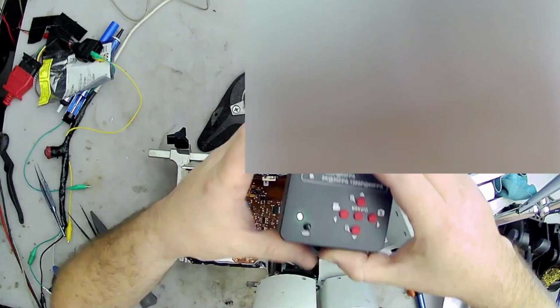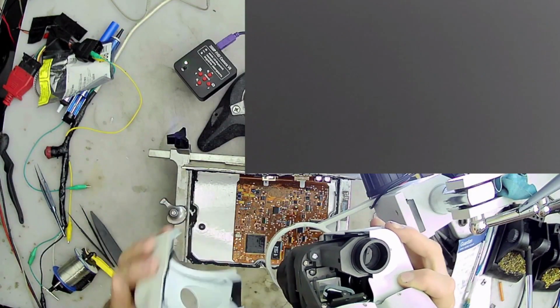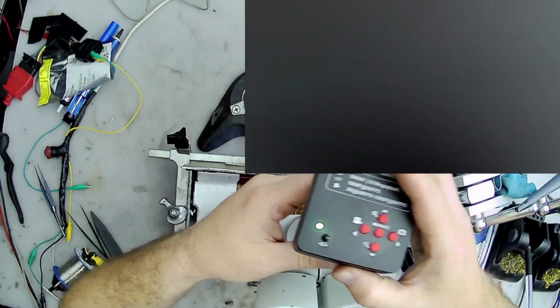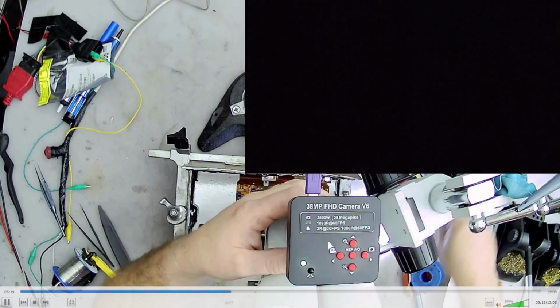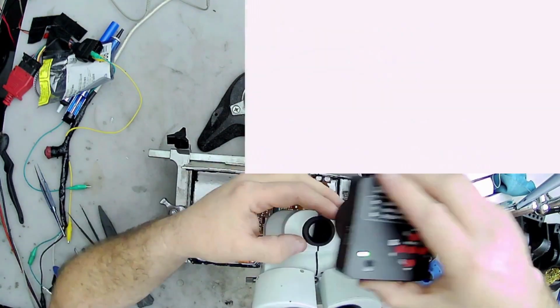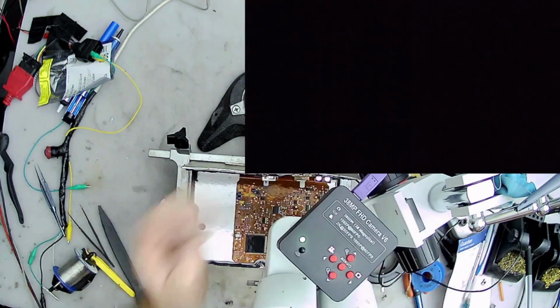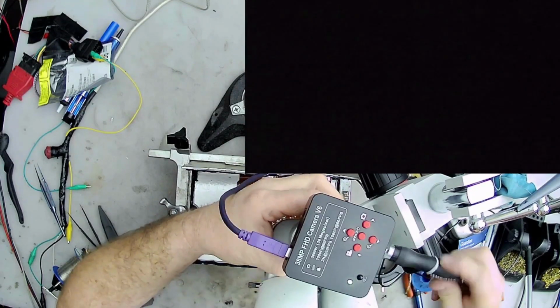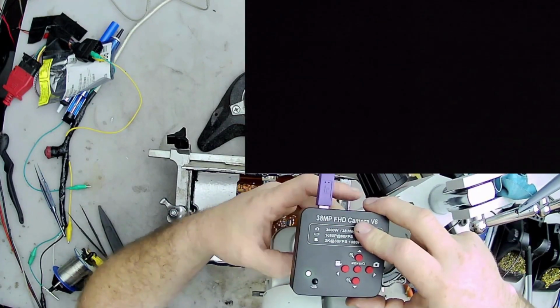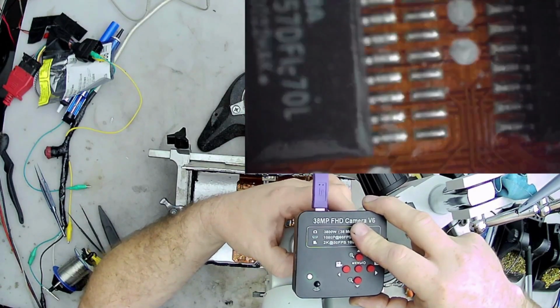So, if you have the same problem, you might want to line up the eyepiece first before you take it apart. And mark the case. You'll see how I mark the case here. My particular mounting piece here has three little set screws on the bottom. And what I end up doing is, once I have it lined up, I mark each set screw on the white case. So where that set screw is at, I put a little mark. And then I know that I can take the camera off and see where the marks are at.